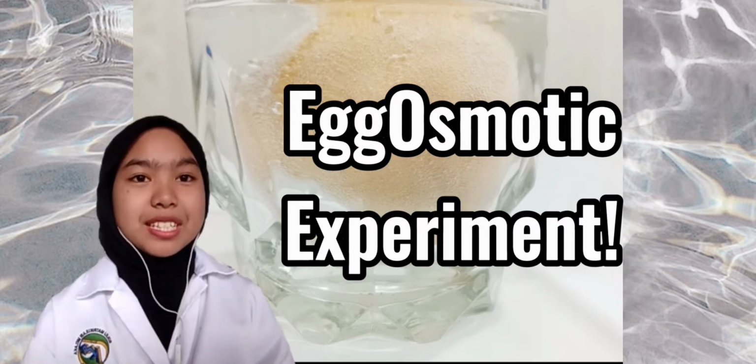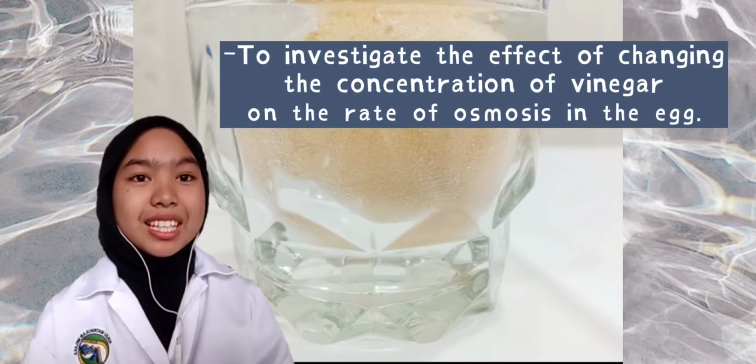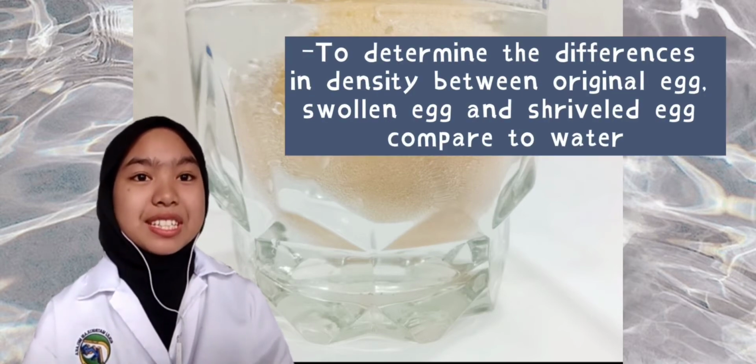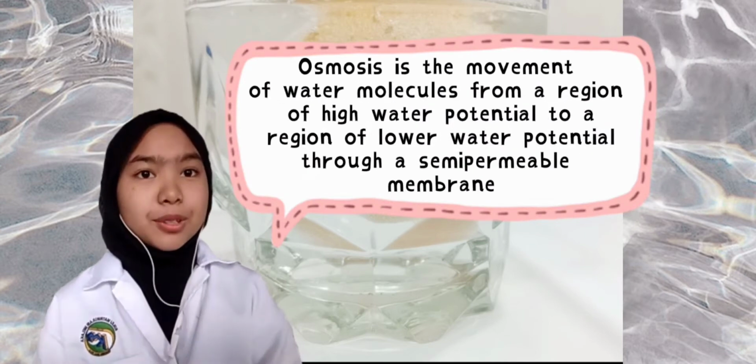The objectives of this experiment are to investigate the effect of changing the concentration of vinegar on the rate of osmosis in the egg and to determine the differences in density between the original egg, swollen egg, and shriveled egg. So, what is osmosis?